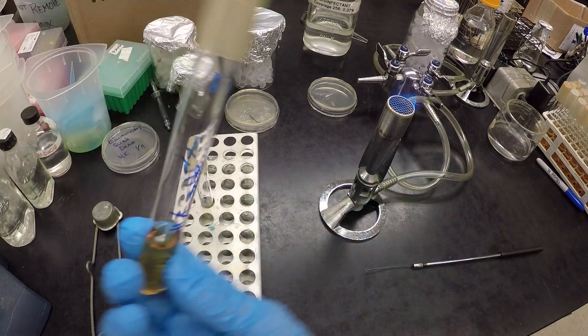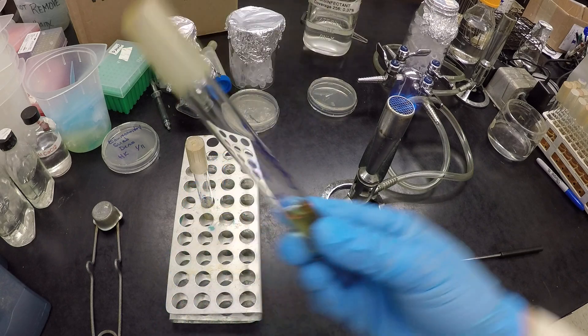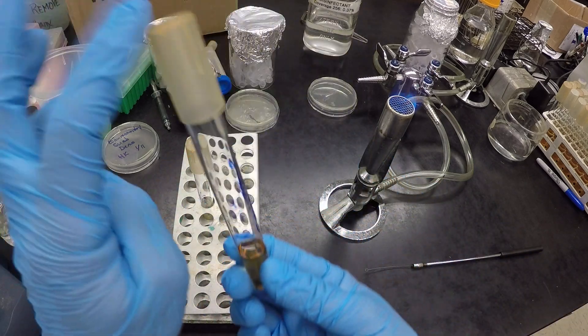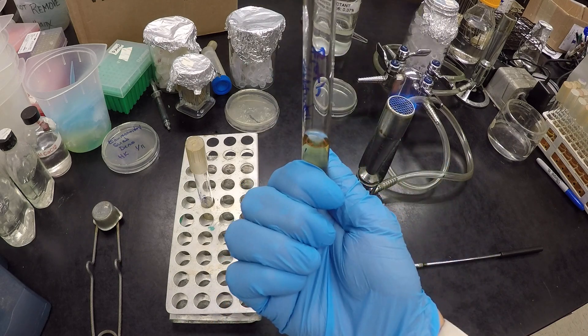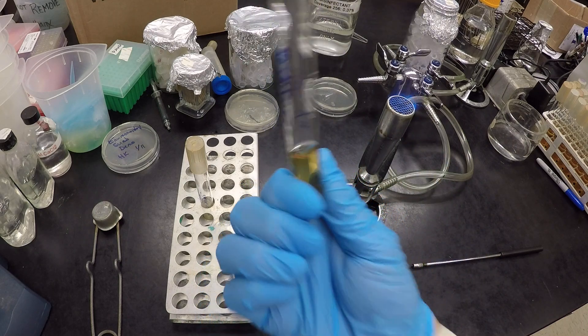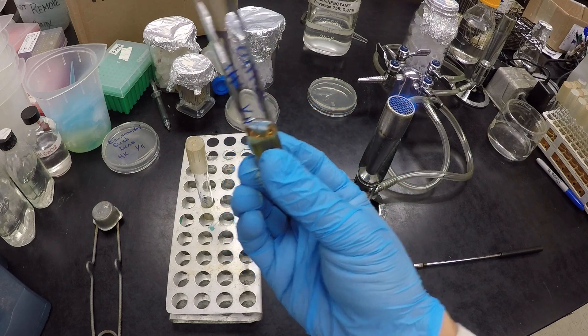Now make sure we don't tip our broth anywhere more than 30 degrees out because these lids are not watertight. Things will leak out of there. This is sterile, not a huge deal. But if this has bacteria growing in it, that becomes a huge deal.